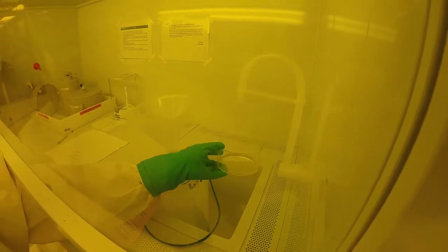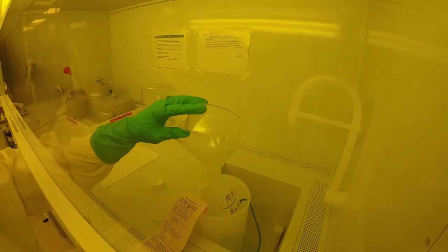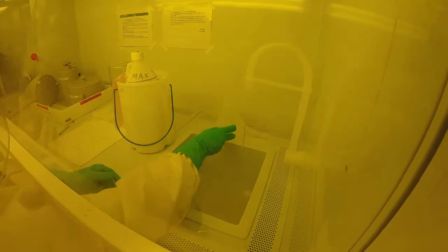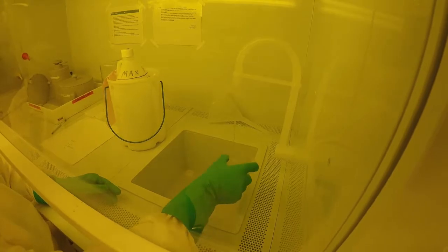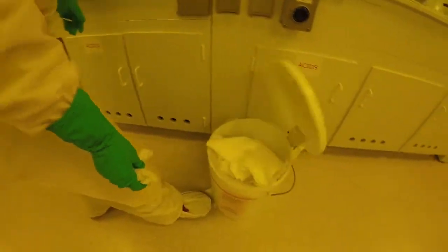Ensure that you leave a note indicating a reaction is taking place and notify staff. Never fill beyond the max fill line. After pouring your waste, rinse the funnel in the DI water sink and place the cap tightly back on the waste bottle. Return the waste bottle to the waste storage cabinet. Solid waste, such as contaminated wipes, should be disposed of in their designated waste trash can.